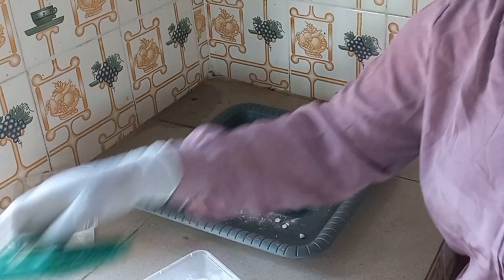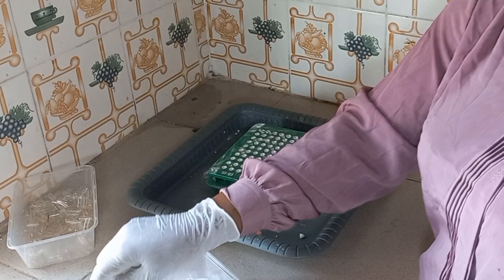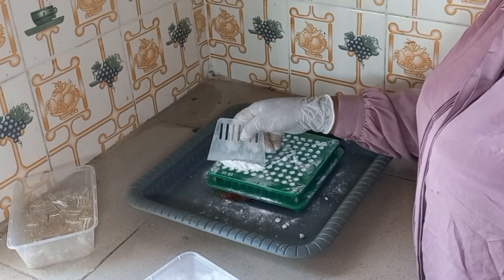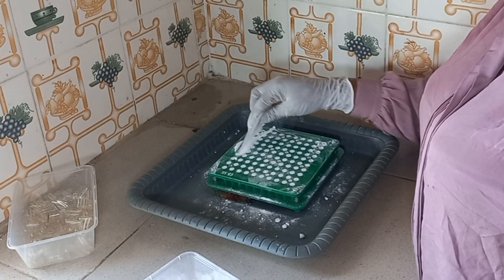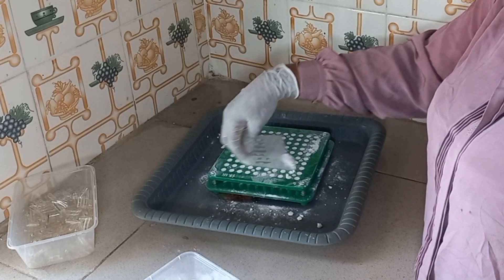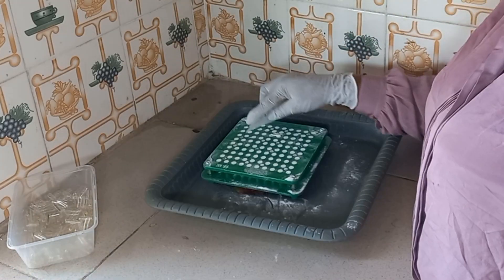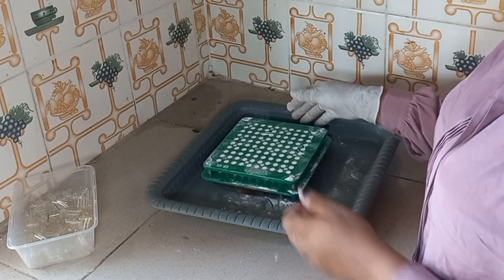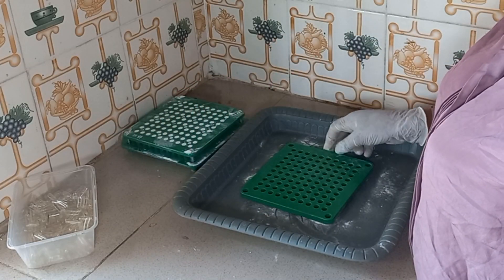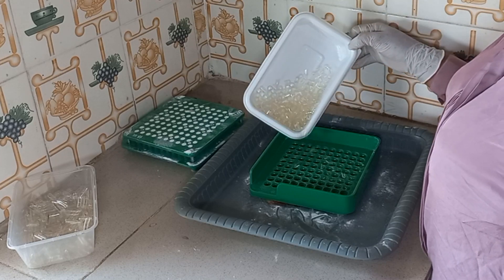We process one more time. Now we are done; we move the edges. What I will be doing now is to fill the parts — this is the cover side — and fill the cover.